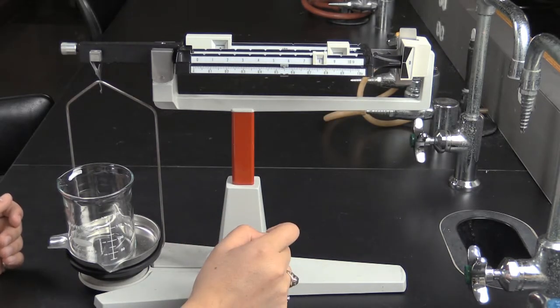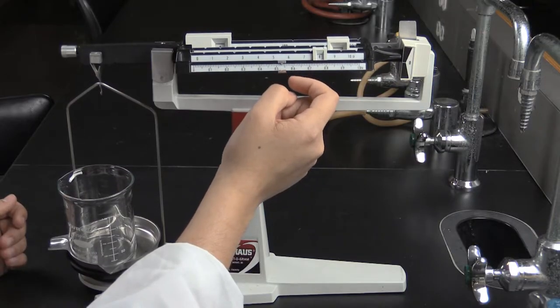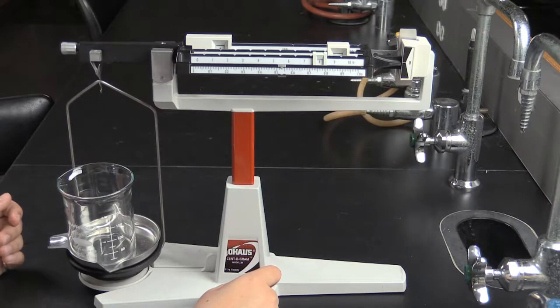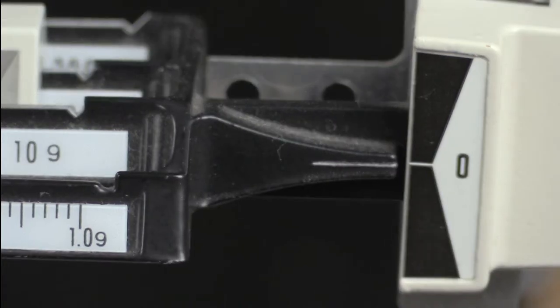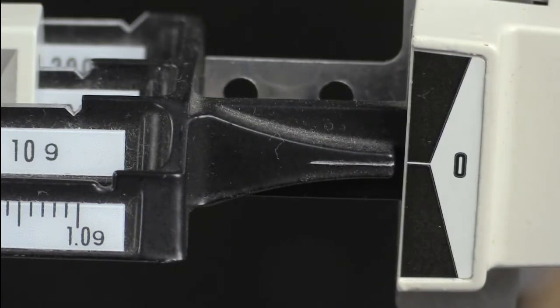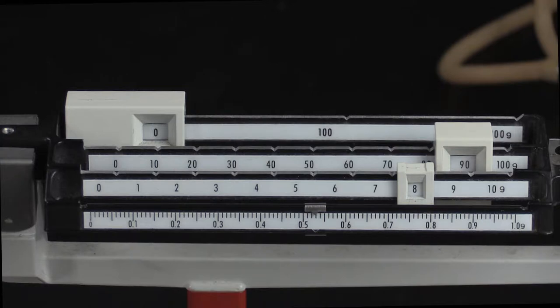The closest slider is the only exception to this, as it has no notches. Slide the smallest slider back and forth until you re-establish balance and the lines line up. Once you have established balance, you are ready to read the balance.